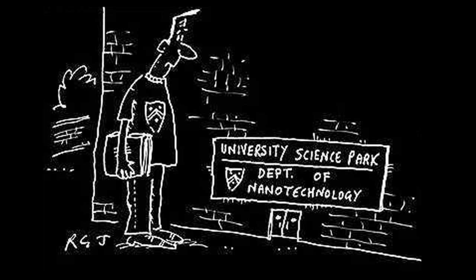Nanotechnology is a study of changing matter on an atomic scale. For our experiment, we will be creating ferrofluid, a liquid that responds to a magnetic field.